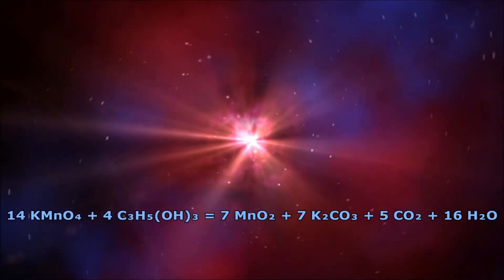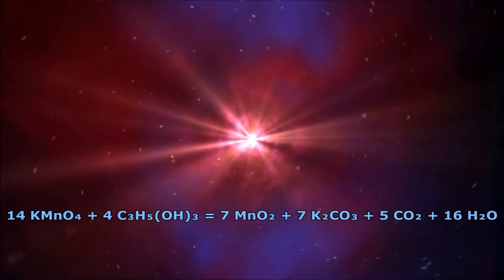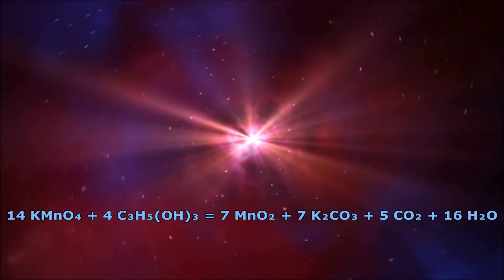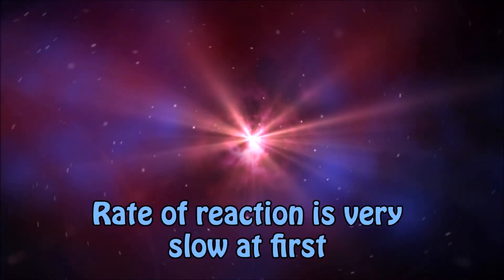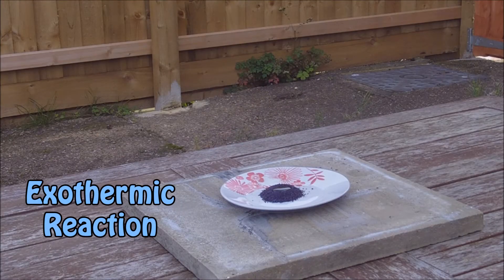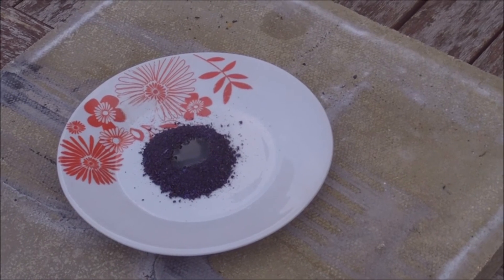The reaction between potassium permanganate and glycerol can be written as follows. The reaction produces manganese dioxide, potassium carbonate, carbon dioxide gas, and water. The rate of reaction is very slow at first and requires a lot of energy. This is an exothermic reaction and produces energy in the form of light and heat.